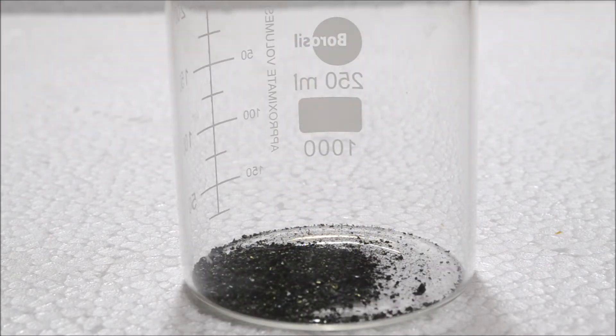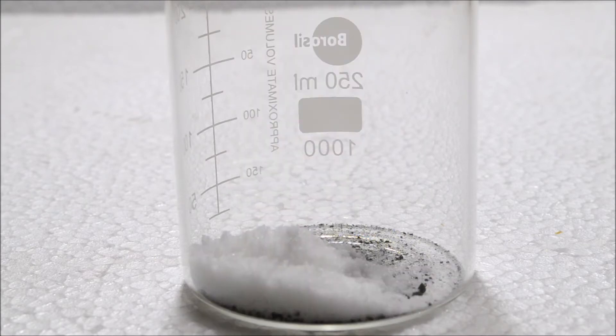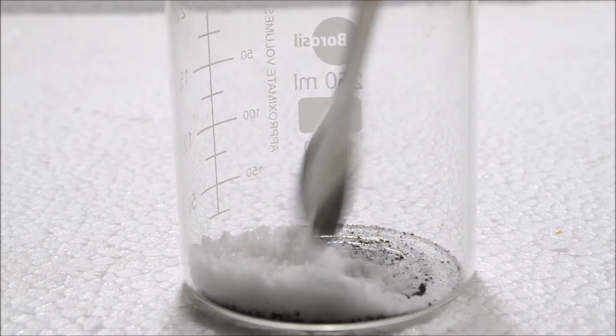Then roughly the same amount of crushed and dried oxalic acid dihydrate crystals are added in. Both the reactants are mixed immediately.